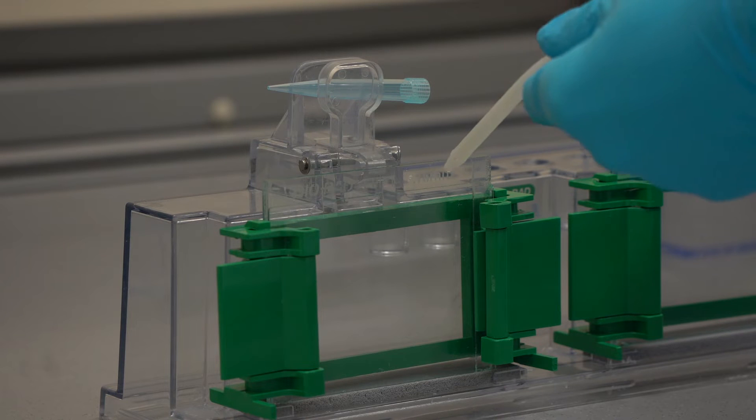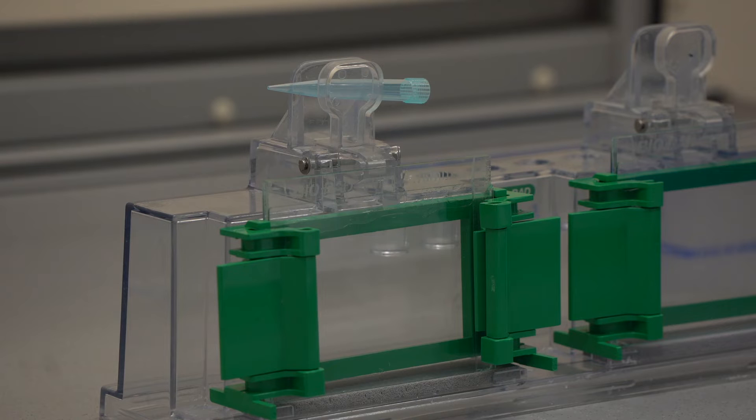Make sure that the gels do not leak and they are well placed. You can check this with water. And if the slides leak, remove them, realign, and place them again between the clamps.